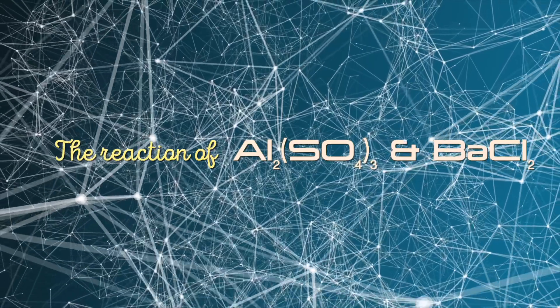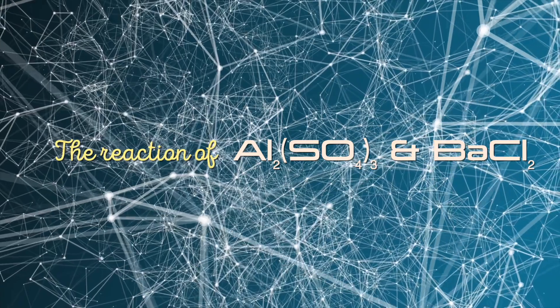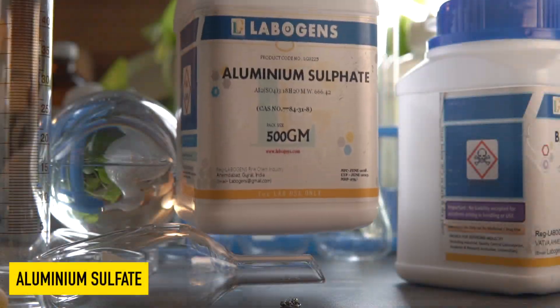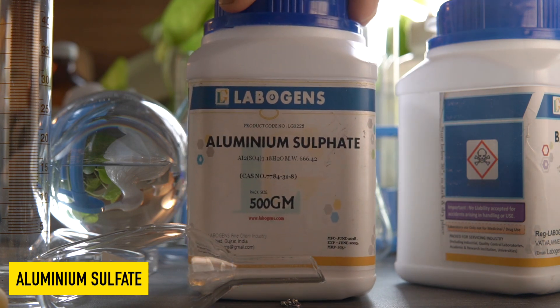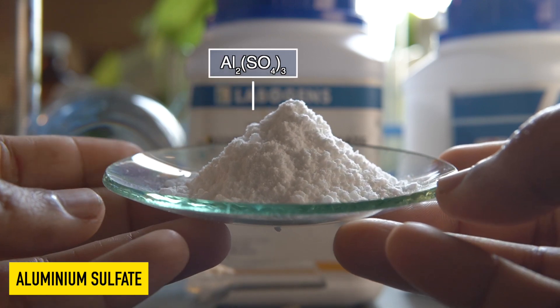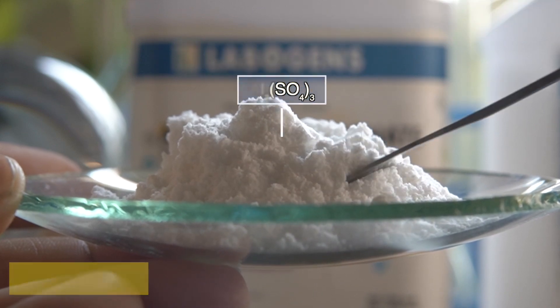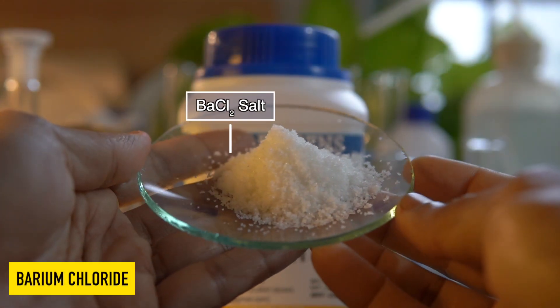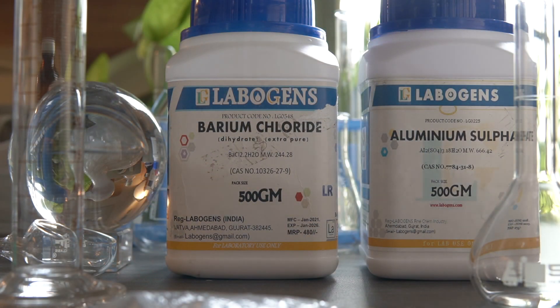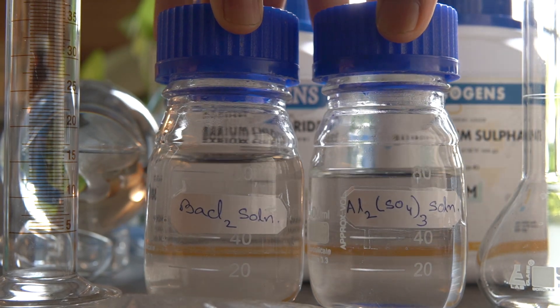Today we will observe a chemical reaction between Aluminium Sulphate and Barium Chloride. This is Aluminium Sulphate, a white powdery substance, and this is Barium Chloride, a white crystalline salt. Both salts are highly soluble in water and can easily make a homogeneous solution.